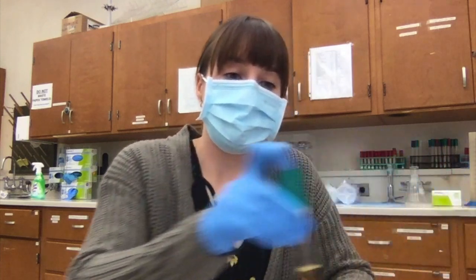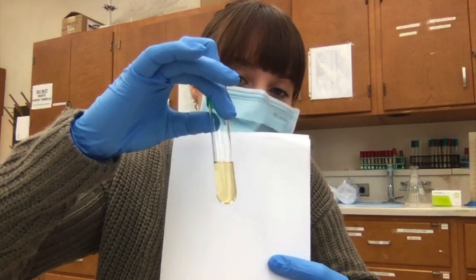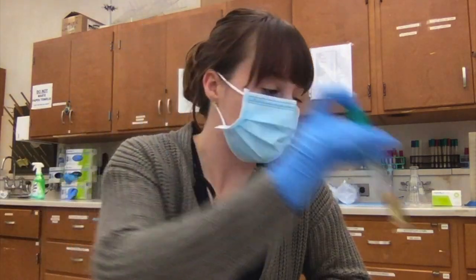So if you remember, we make two types of culture media. The first is liquid and the other is solid. When we use solid, we use agar, which is our solidifying agent. So I'm going to show you first a broth, which is simply put into a tube, and it's completely liquid. You can tell if there's contamination by looking for cloudiness, and this is clear. And so this is a successful and good broth.